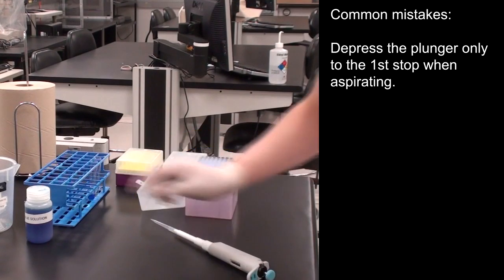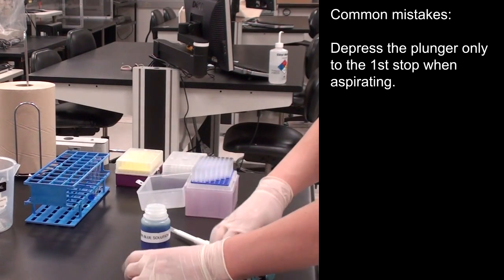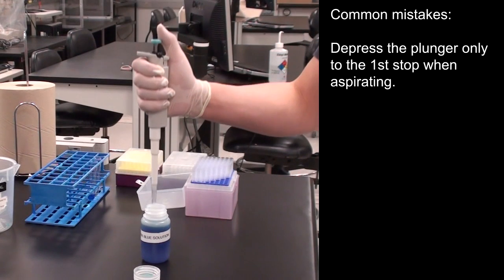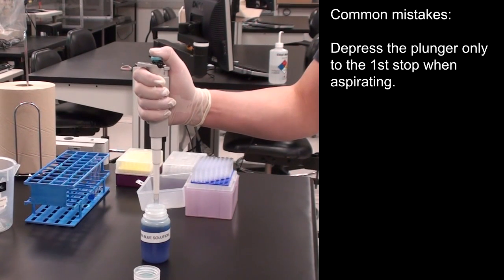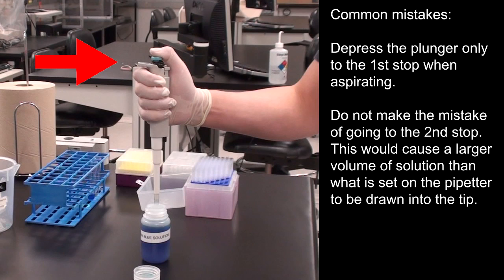Remember, depress the plunger only to the first stop when aspirating. Do not make the mistake of going to the second stop. This would cause a larger volume of solution than what is set on the pipetter to be drawn into the tip.